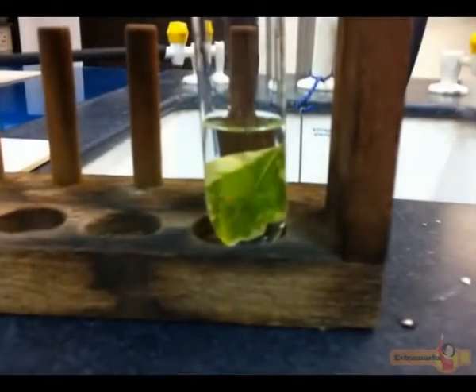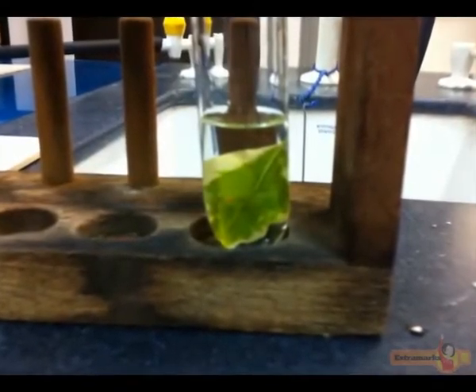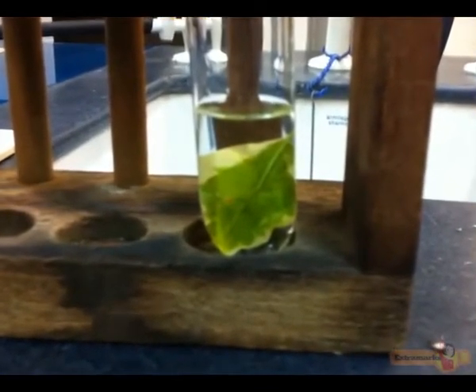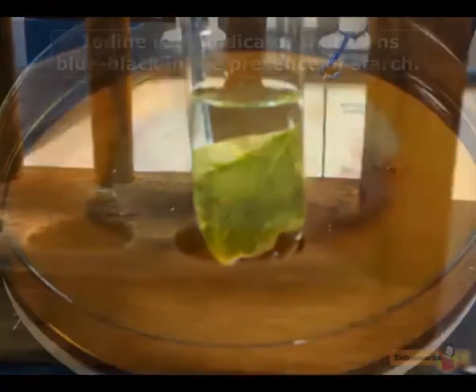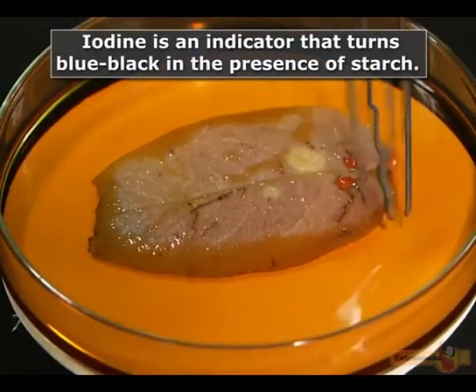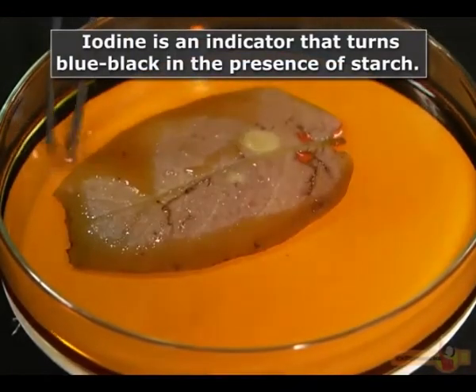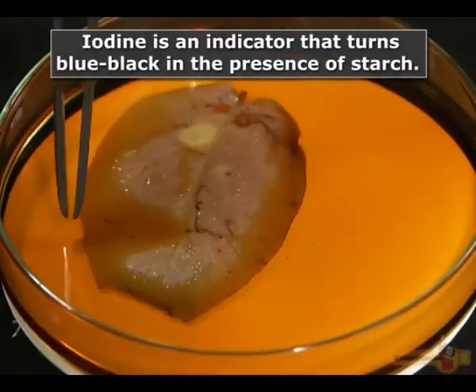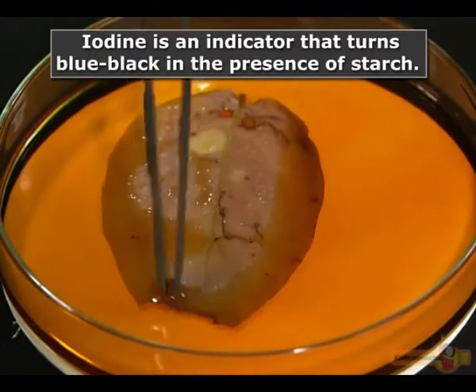The decolorized leaf is then washed in water and dipped into the dilute iodine solution. The presence of starch can be detected visually by a change in the leaf color.